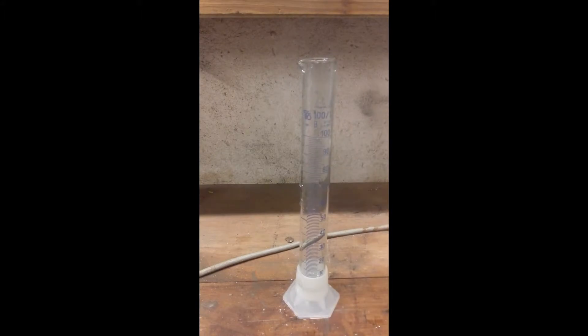You can pour your acid directly into the jar if you have the temperature under control. For hydrochloric acid it's not a problem but we guess you can try other acids. Also we used 30 ml but it was too little.